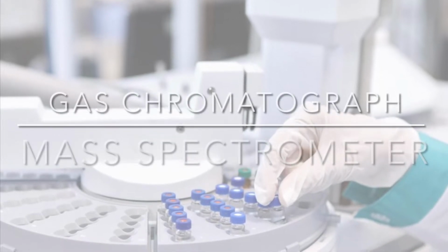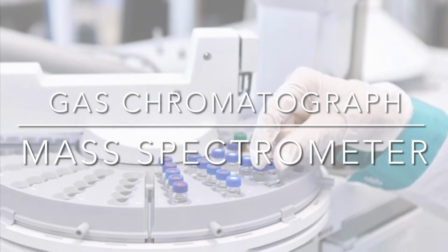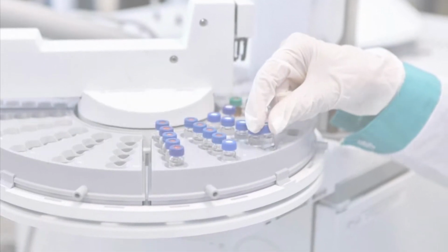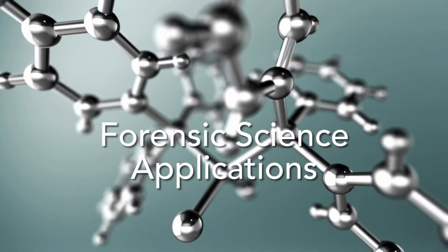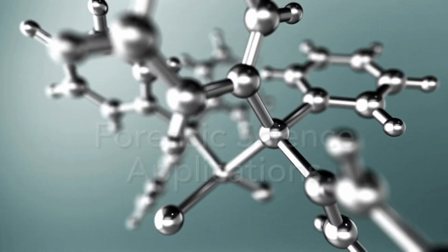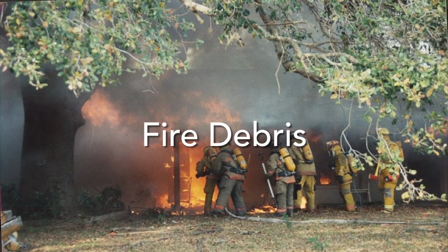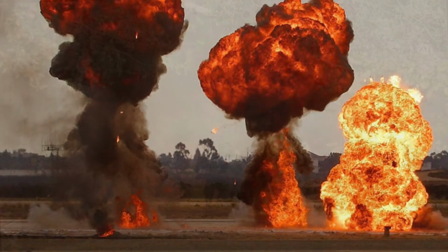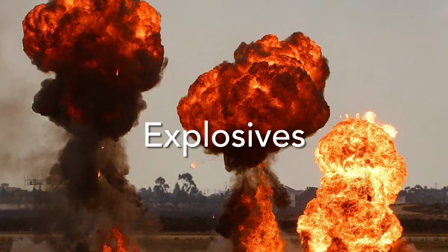Our tour of instruments utilized in forensic science laboratories begins with the Gas Chromatograph Mass Spectrometer, often referred to as the GCMS. Many forensic science disciplines apply gas chromatography mass spectrometry for the analysis of casework samples. GCMS is used to analyze residues from fire debris for the identification of an ignitable liquid and explosion scenes for the identification of low or high explosives.